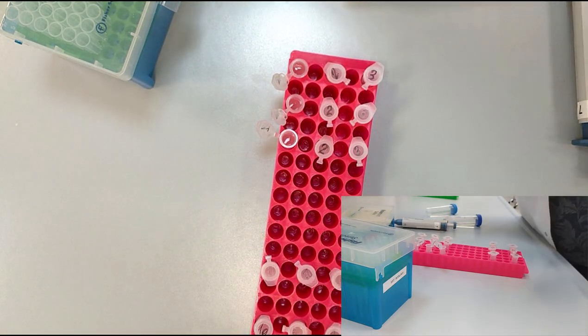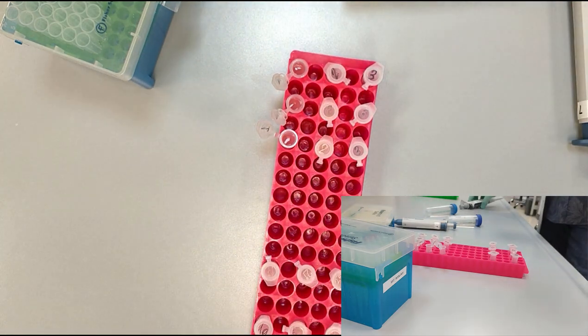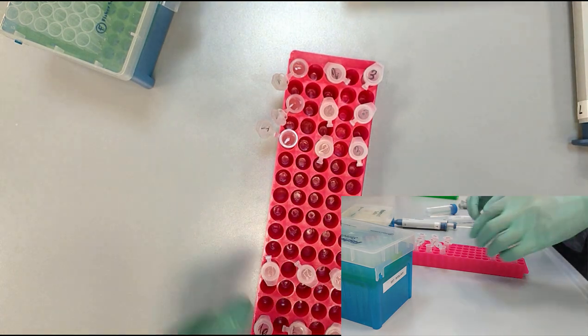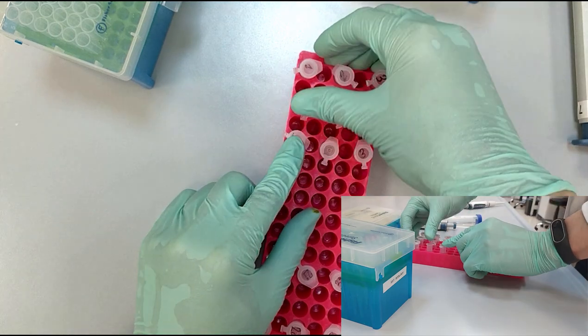We discard the tip into the tip bin, and then close the lids on the eppendorf tubes.